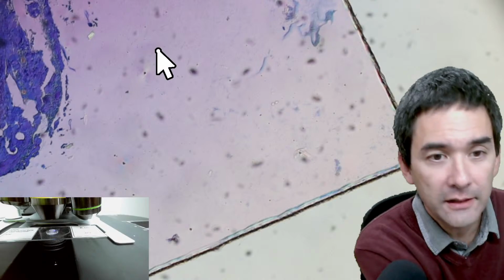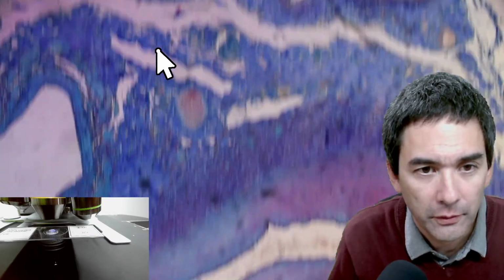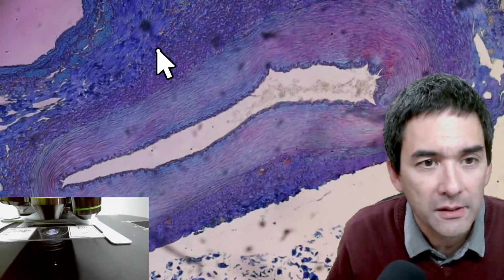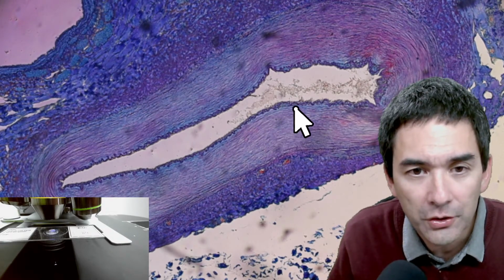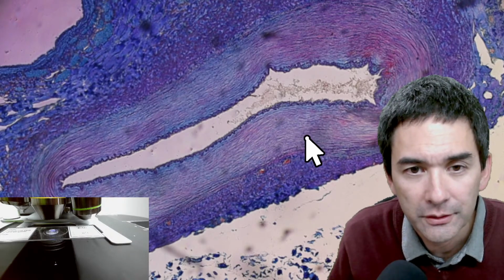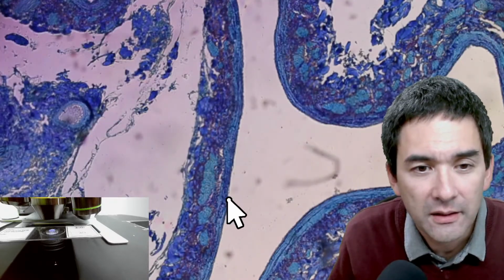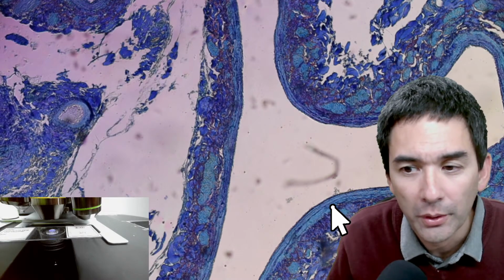If you joined in late, the video is of course available afterwards for viewing. So this here, for example, is an artery. This here, cross section again. Arteries have a very thick wall because they have to withstand the high blood pressure. And this over here is the inside of a vein. It's pretty collapsed. You see that the vein has a much thinner wall because the blood pressure is much lower.